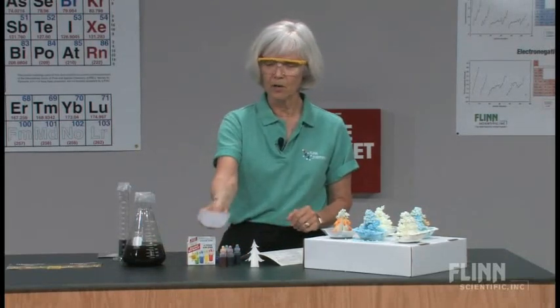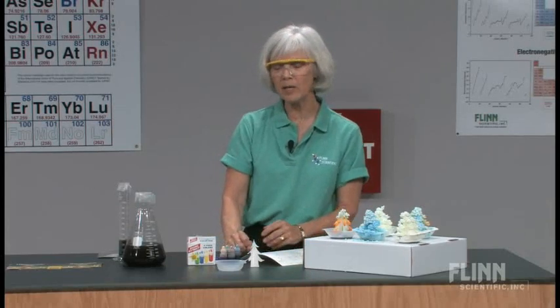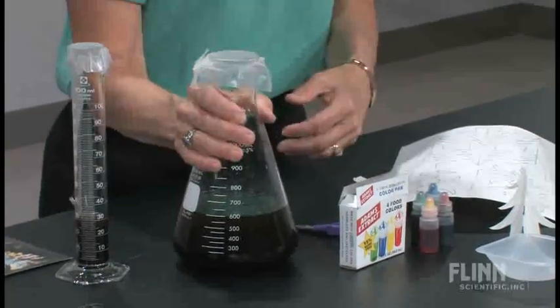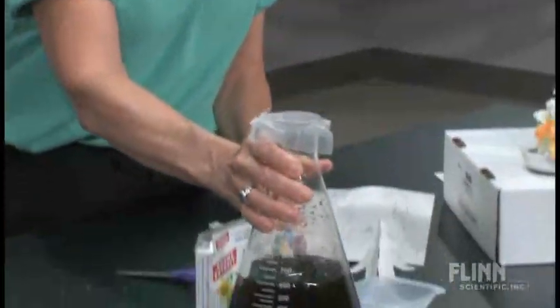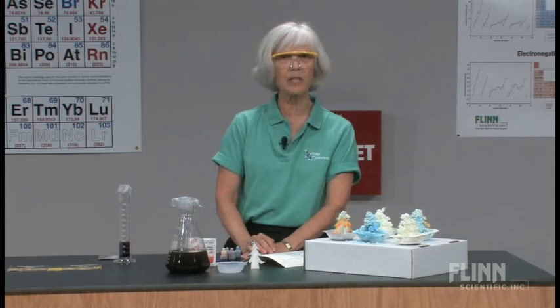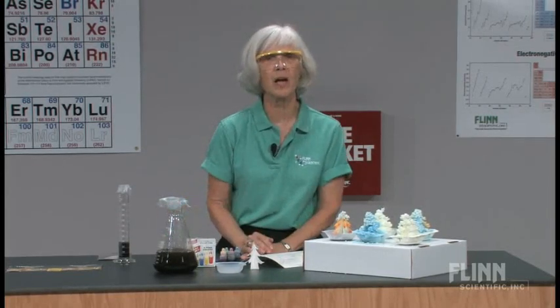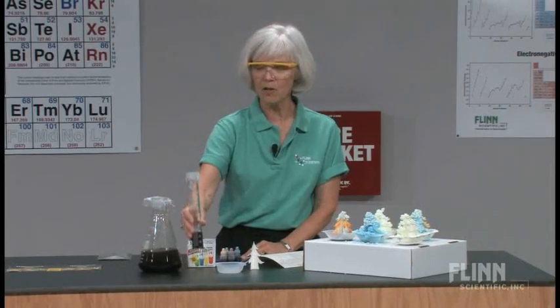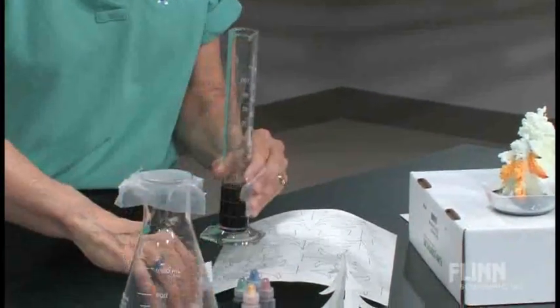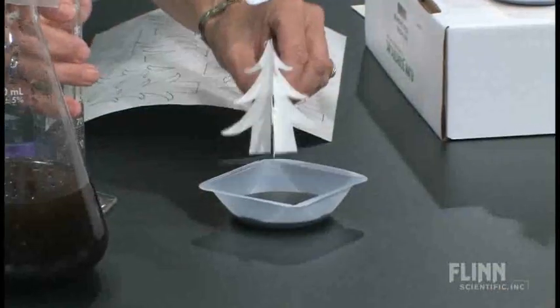What we're going to do is grow sodium chloride crystals. We need a saturated solution of sodium chloride, but the solution contains more than sodium chloride — it also contains ferrocyanide ions and ammonia. The solution itself looks really strange, and in fact there's generally salt sitting at the bottom because it is a saturated solution. So when you make up this solution, you really want to swirl it around before you pour some out.